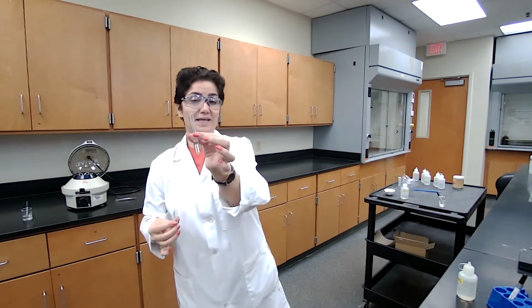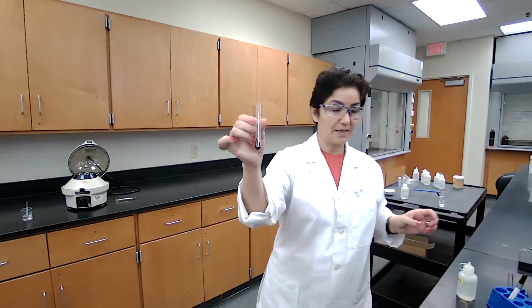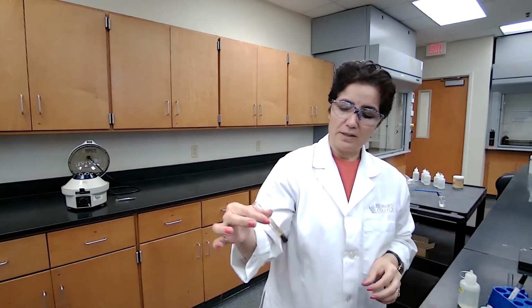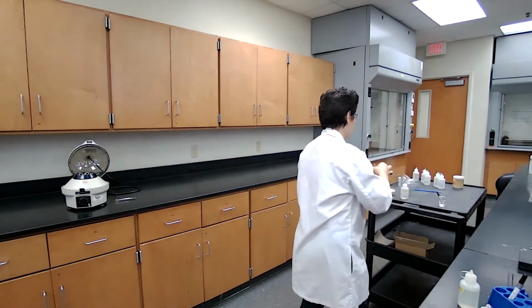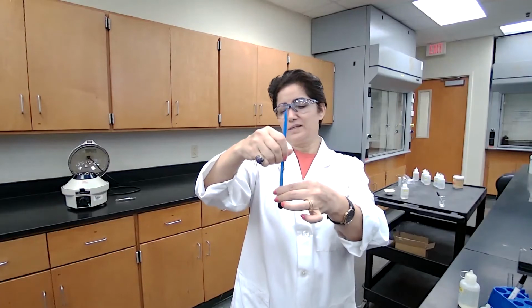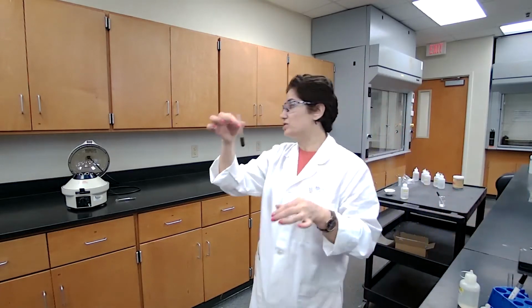Now, I'm saving the test tube B for further analysis for the next steps. For the precipitate, I need to wash it. I'm going to add the deionized water, just following the procedure, and you can just watch me and record your observation. I'm adding the water based on the procedure. And this would be the washing of the precipitate. So I want to make sure that I mix it well with the stirring rod to wash the precipitate with the solutions that I added, and centrifuge again.